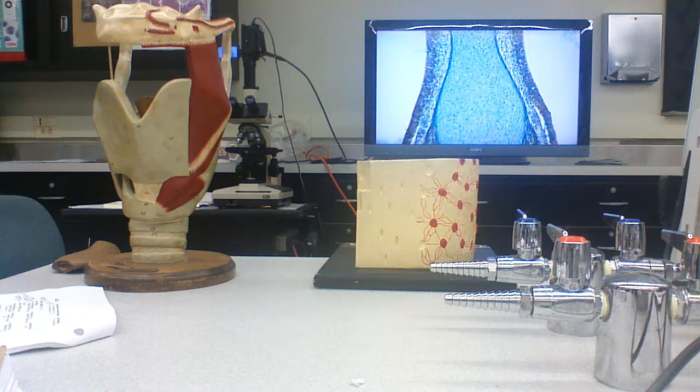And the same thing is happening down here, where you're going to have ossification occur and the same kind of stratification. So here's what's going on. The bone is growing this way.